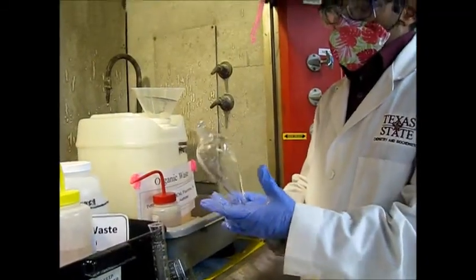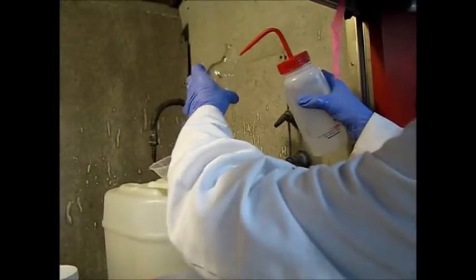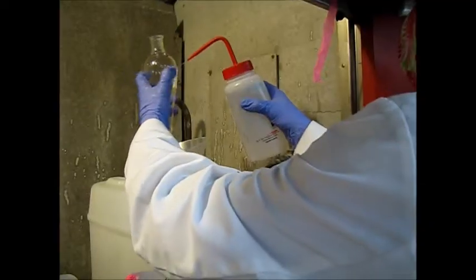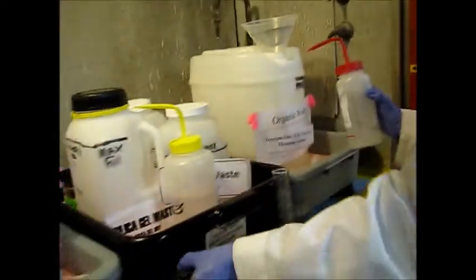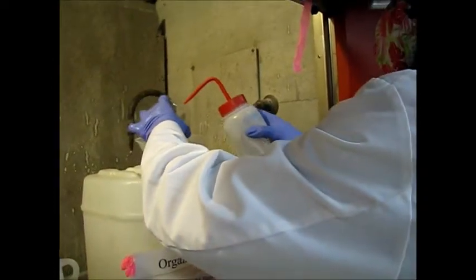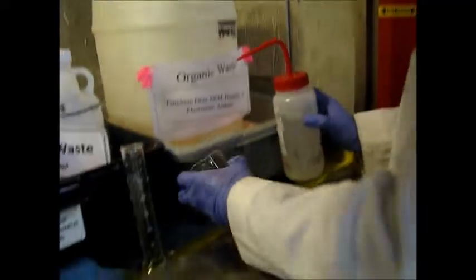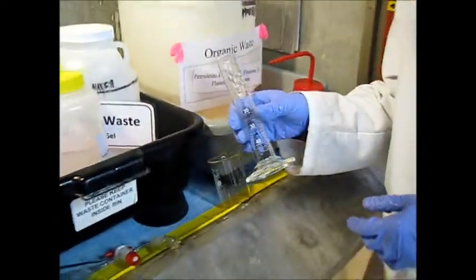So once you clean with the soap water, you have to rinse it again with the acetone to dry it. Then you will be ready to keep in the drawer or we will use this for filtration, for rinsing the compound.